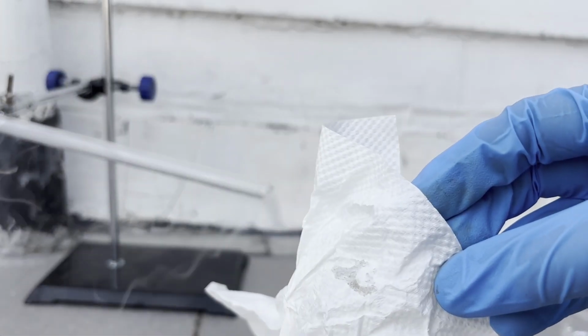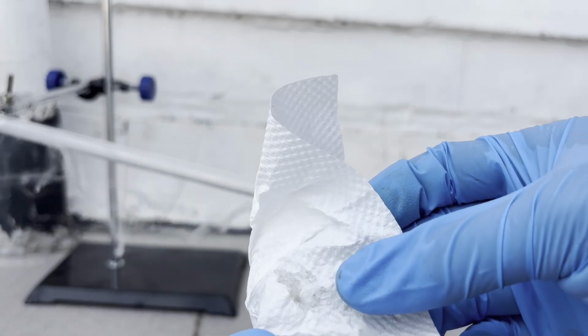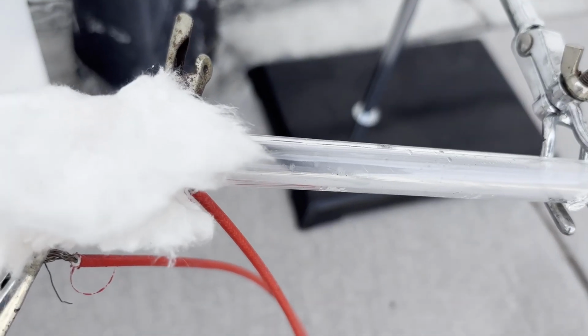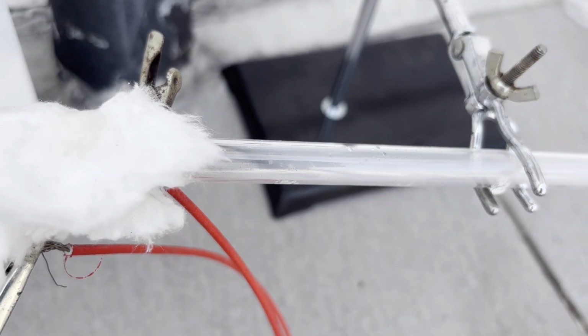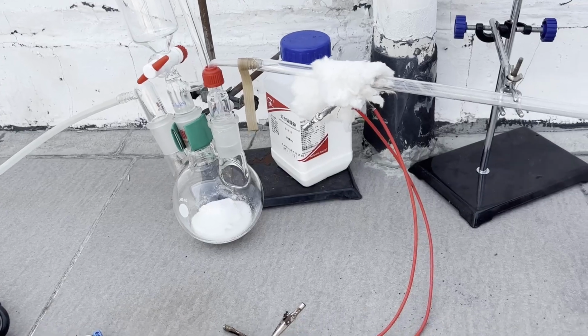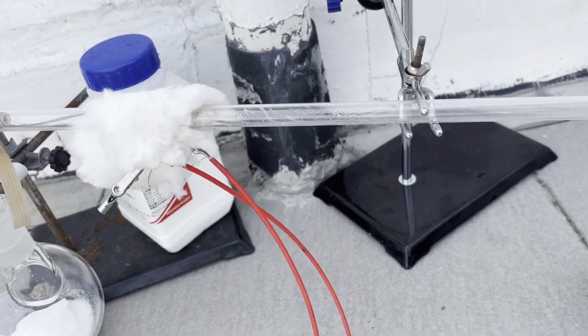I think the main reason behind all this is that the sulfur trioxide is diluted with a lot of nitrogen and leftover oxygen from the air, and the nitrogen flow sort of carries it along things and greatly diminishes its reactivity. However, I was still able to collect some significant evidence that we're making sulfur trioxide. One evidence was that the inside of the quartz tube was coated with a slightly oily liquid after some time, which could only be sulfuric acid formed from residual water.